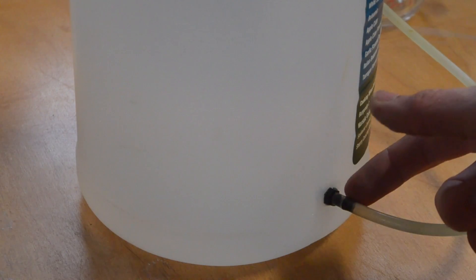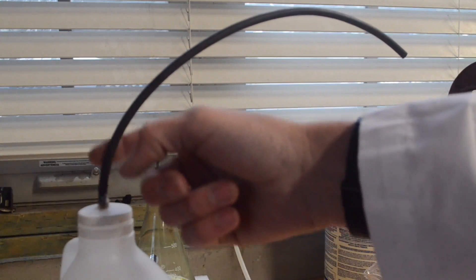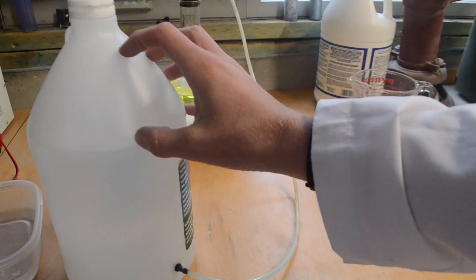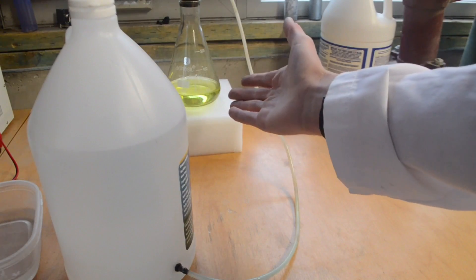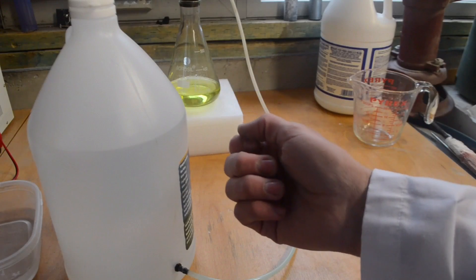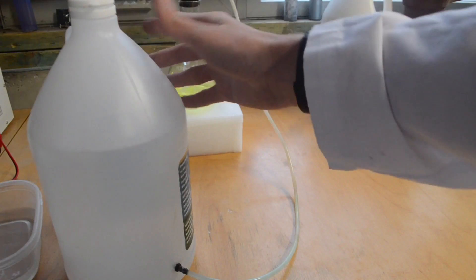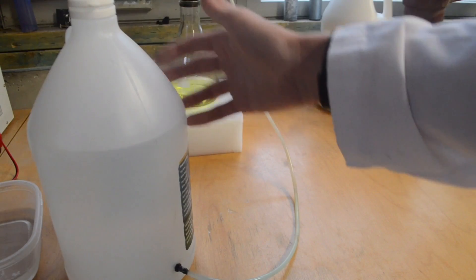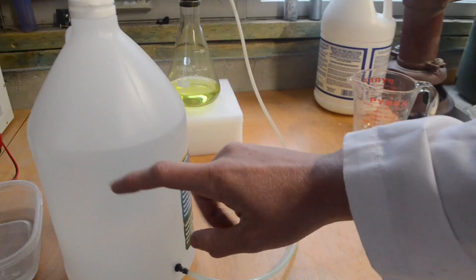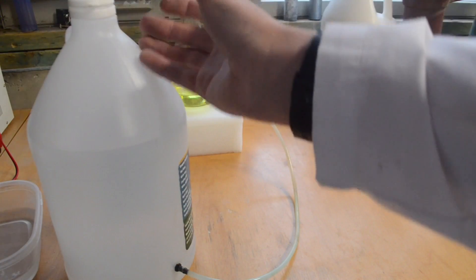I got another one of those tube connectors, put it in, and put two-part epoxy around it. Then on top of the bubbler, I used epoxy again to attach this black tube. It is very important that you do not skip the step of adding in this bubbler. Since this reaction is exothermic, it frees up hydrogen chloride gas from the solution. Hydrogen chloride gas can be very bad for your health — just yesterday I breathed in a bunch of hydrochloric acid gas, and my eyes became extremely bloodshot and my lungs began hurting. So when the hydrogen chloride gas comes through here and goes through this bubbler, it will join into the water. The water will get slightly more acidic, but what comes out the top should be mainly hydrogen.